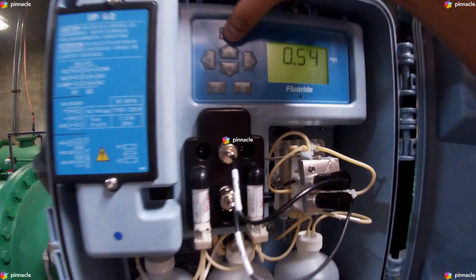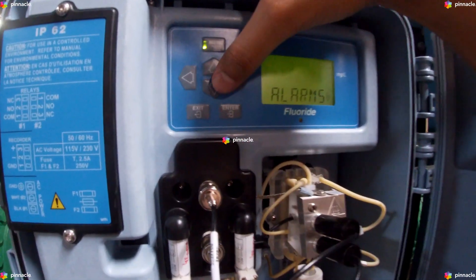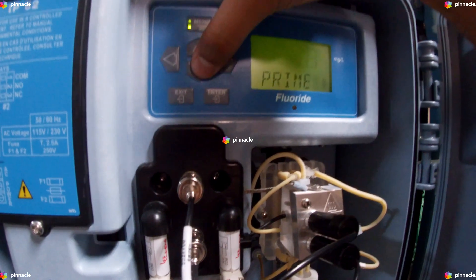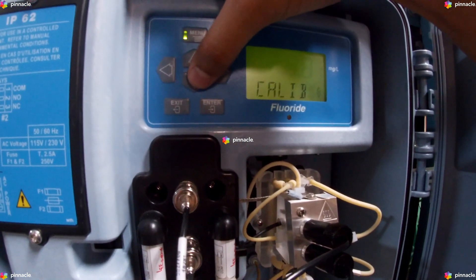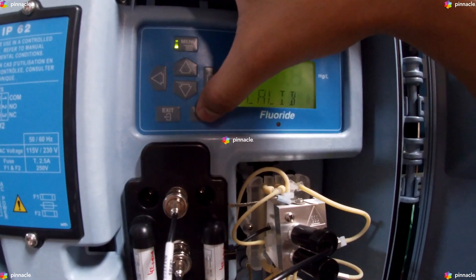We will begin by clicking on Menu, scrolling to Calibration, and pressing Enter.